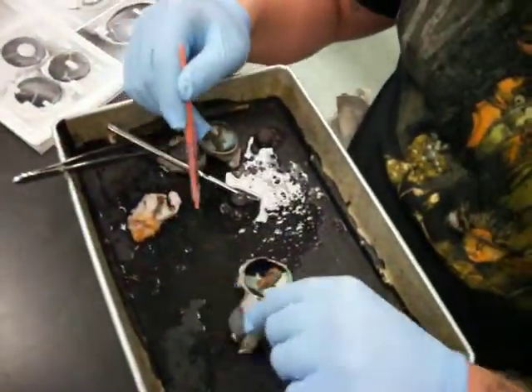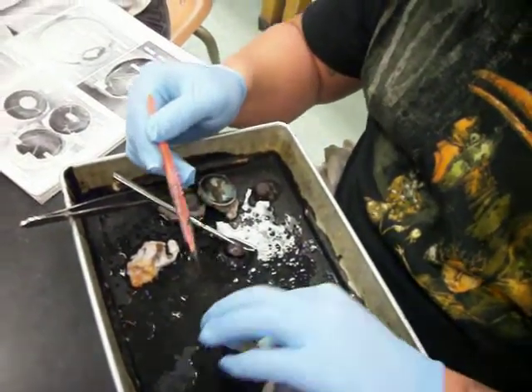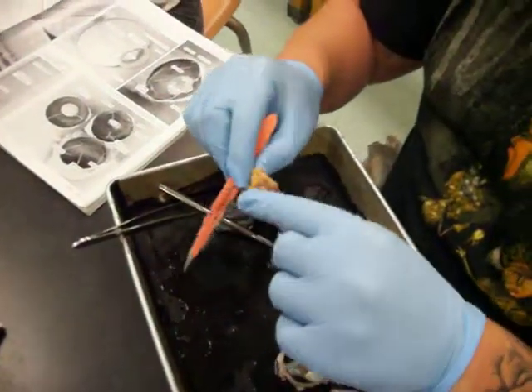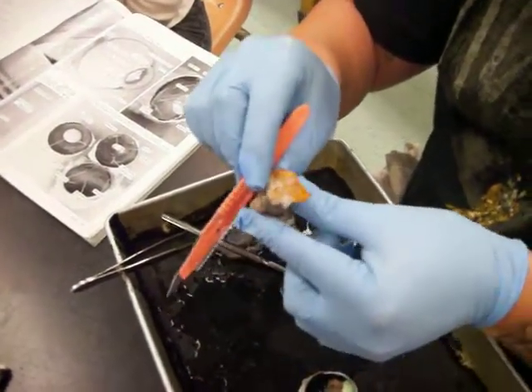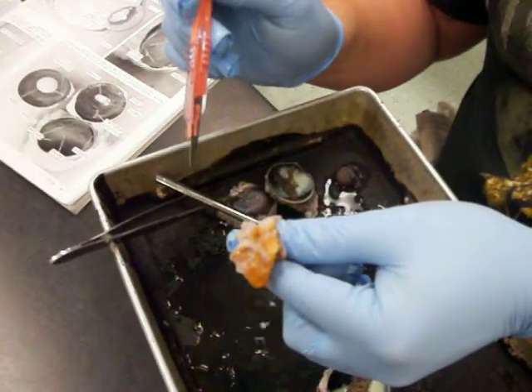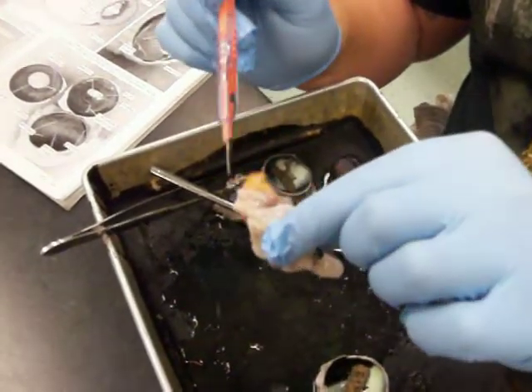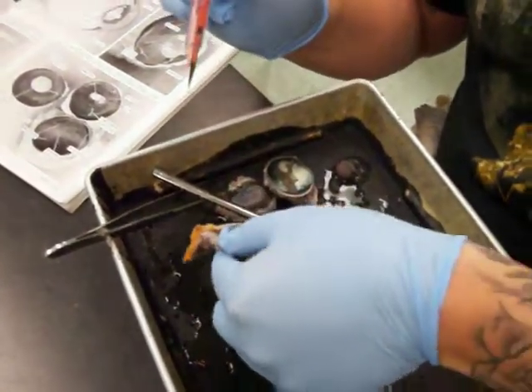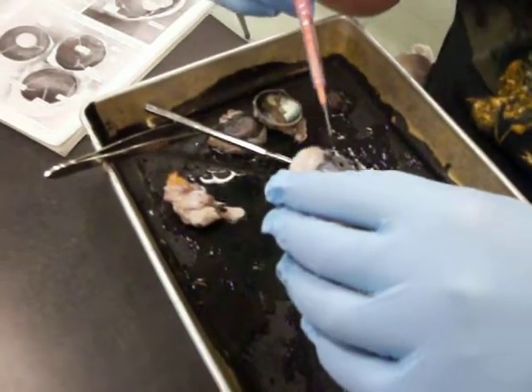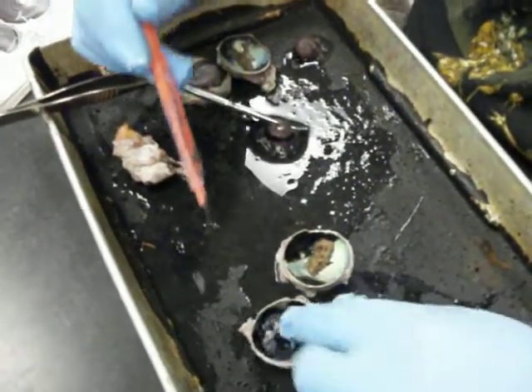Okay, so as you can see, this is the anterior side, this is the posterior side. This is an example of the adipose. Right here, located on the posterior side of the eyeball, this is your postorbital adipose, which basically looks like yellow fat. Gross. So we'll flip this over, which is the anterior side of the cow eyeball, and we'll start going through our structures.